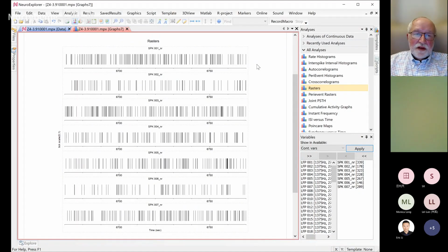But yeah, I can write a simple script. This is very simple. So you want to calculate what, for example, within this, this time minus this time?